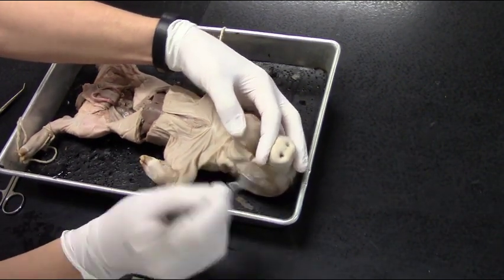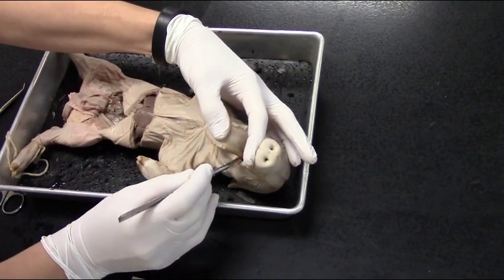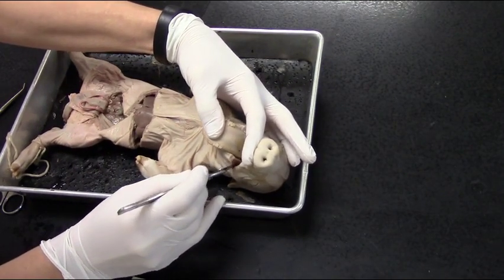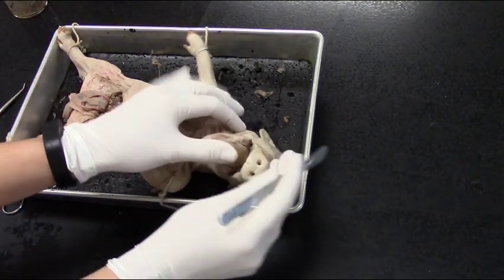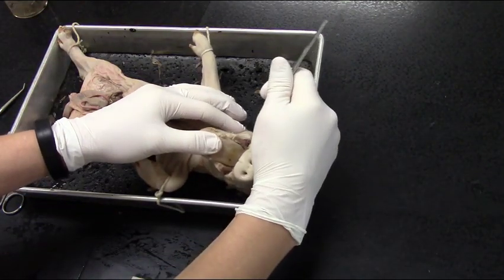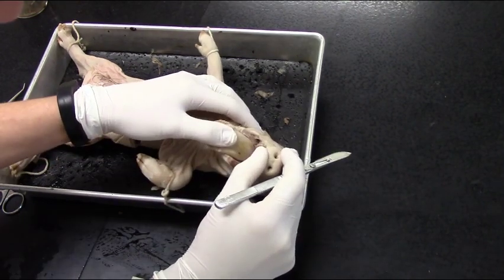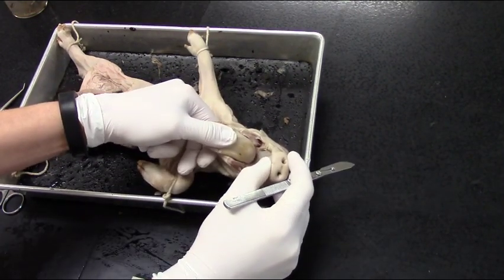Your dissecting guide suggests using scissors. I use the scalpel—I just feel like I have a little bit more control. But you'll notice I'm going to make really gentle, deliberate cuts the whole time. I don't want to use the scalpel on bone because I can risk breaking the scalpel, so just be very careful.